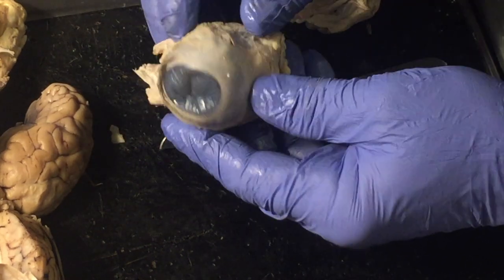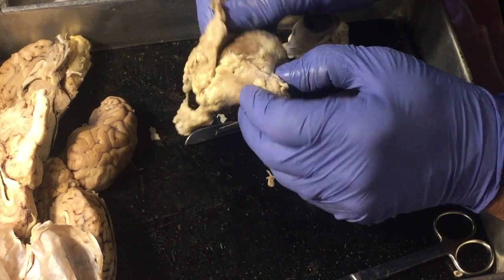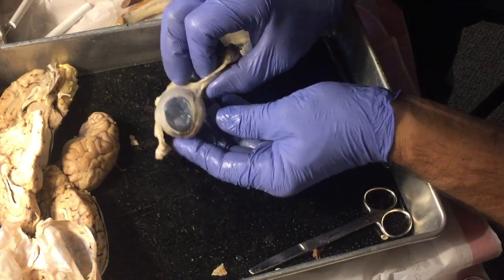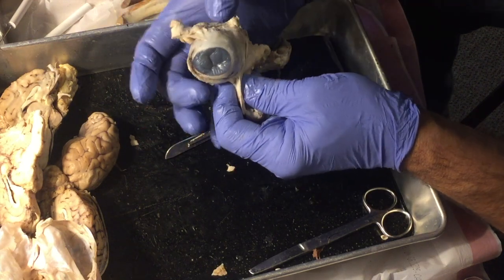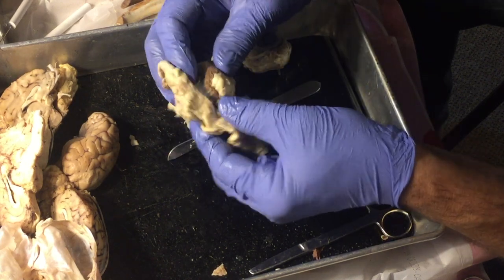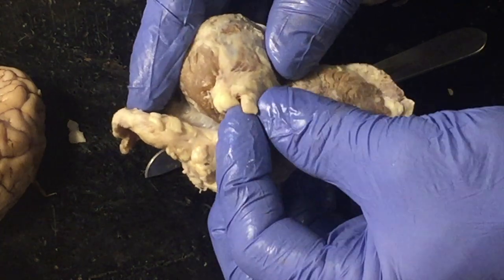Okay, so this is a cow eye, calf eye, and this has been taken right out of the skull. There's a lot of connective tissue here, and I've cut some of that away. And here we can see some of what are called the extrinsic muscles. These are muscles that would allow the eyeball to move around in the socket. And some of them are going to be attached up above and below for the eyelids and lashes and things of that sort. If we turn the eyeball over right here, this rounded structure, it's kind of tough. This is the optic nerve coming out of the back of the eyeball.